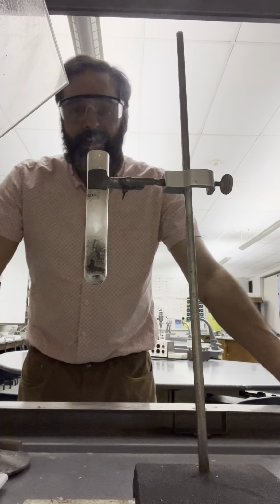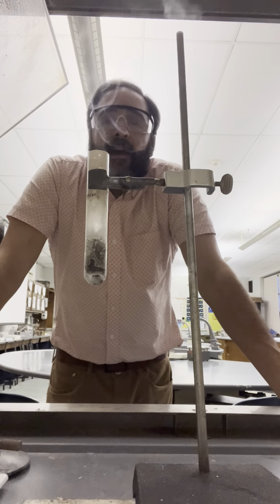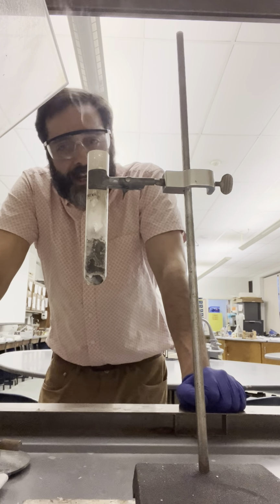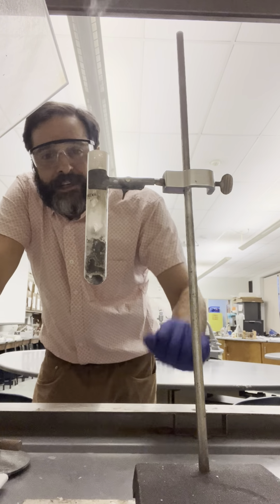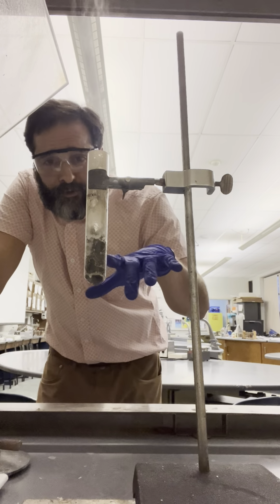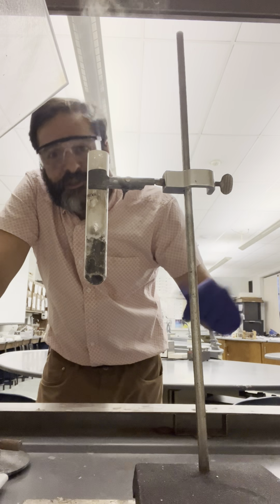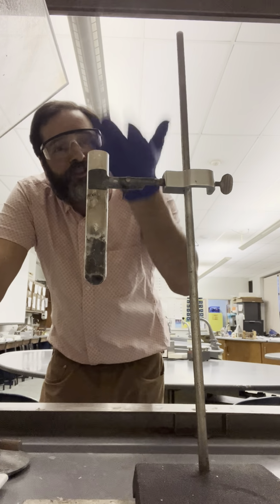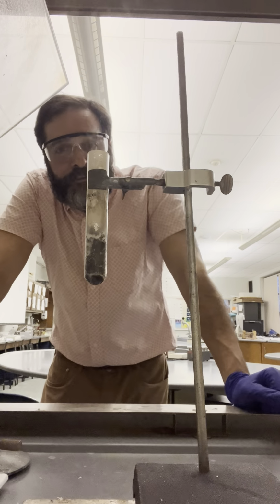Okay, and that is the exploding gummy bear. Notice the whole thing went nuts as soon as the sugar went in there. The hot oxygen reacted with the sugar. That's a combustion reaction. The carbon fuel was the sugar. The oxygen was the oxygen. We just made a lot of carbon dioxide and water. All the smoke you're still seeing is water vapor.